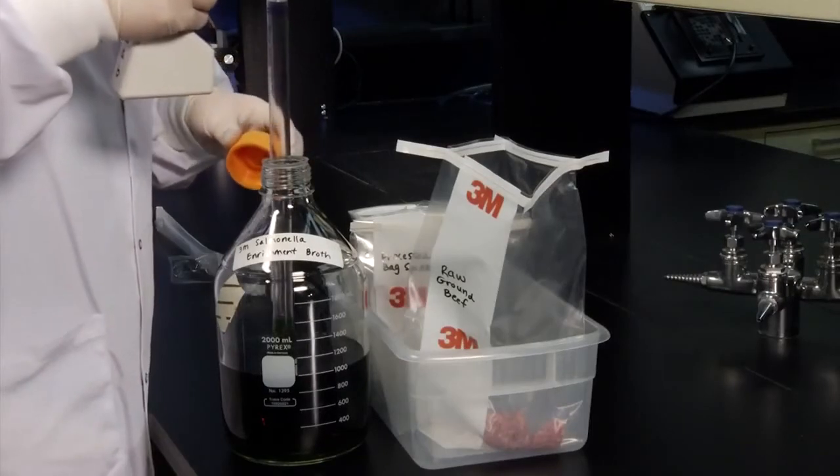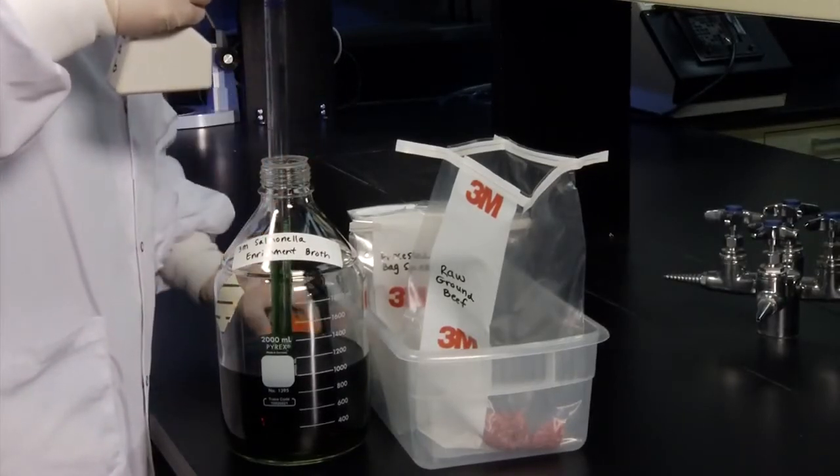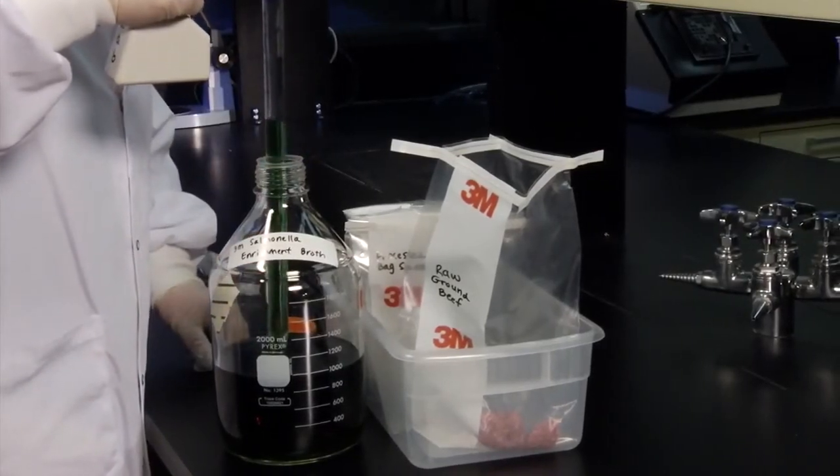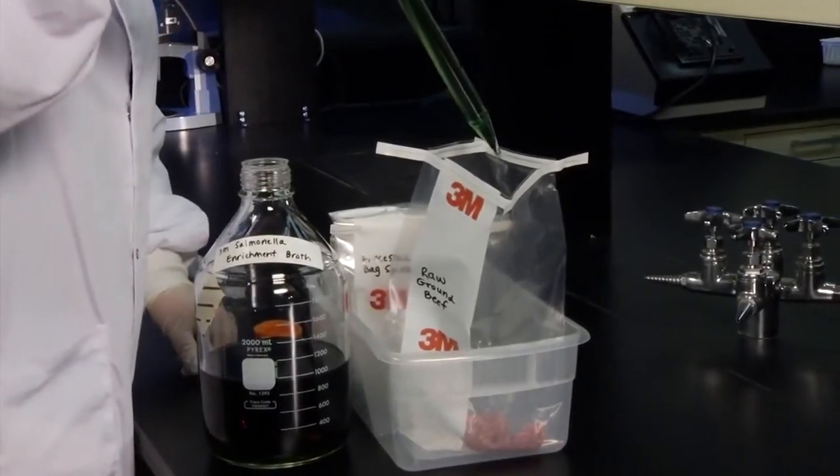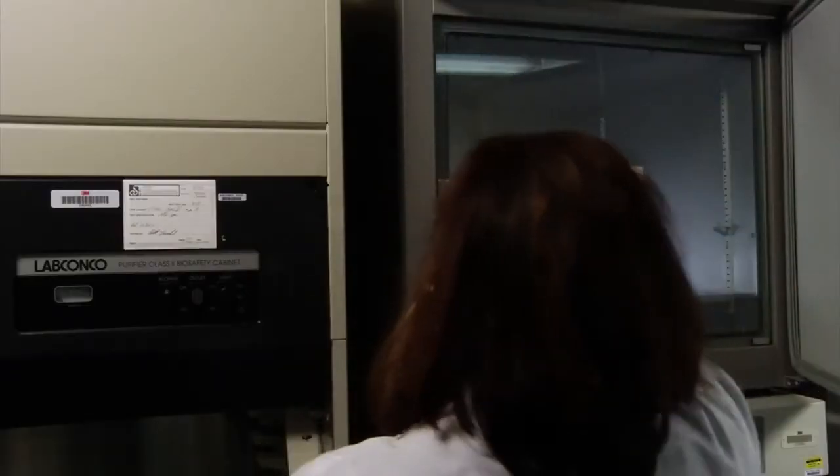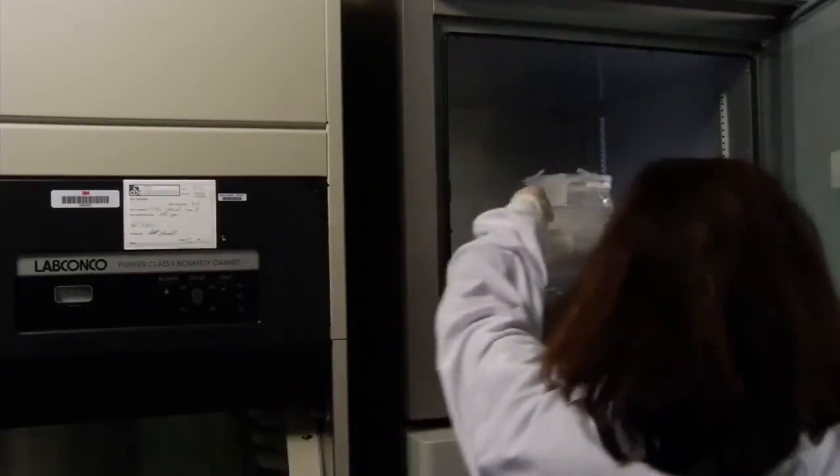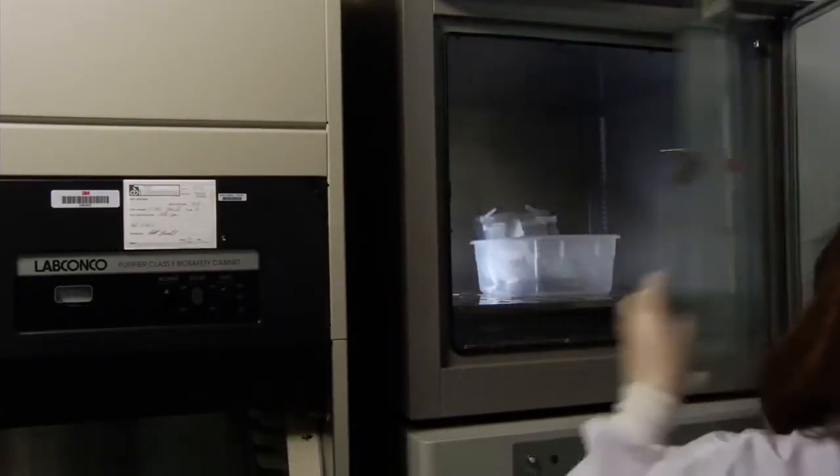After weighing your product sample, add the appropriate volume of base with supplement to the product sample. Homogenize the sample according to your laboratory procedures and incubate the sample in a 41.5 degrees plus or minus 1 degree Celsius incubator for 18 to 24 hours.